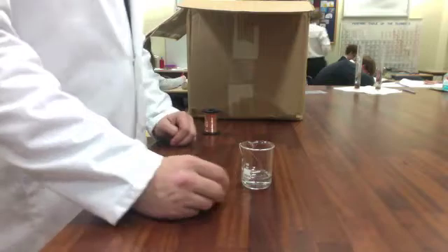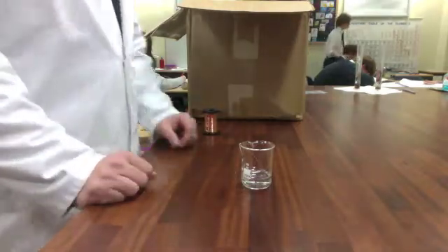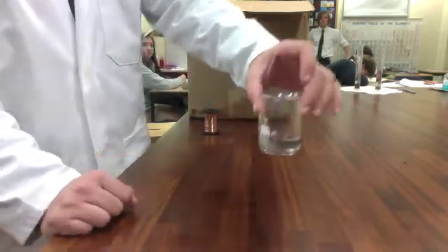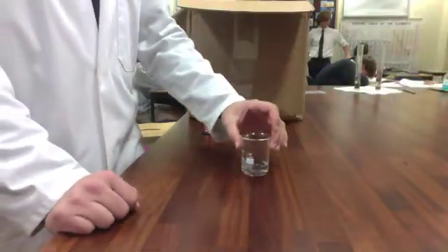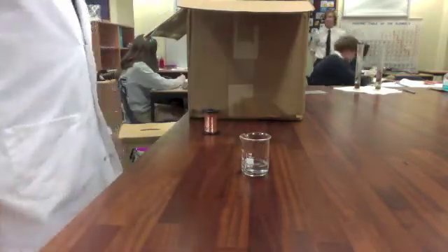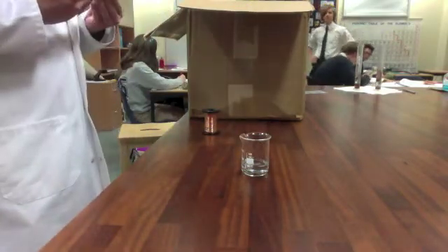Secure that. And you can see that pretty quickly a reaction starts to happen. The copper wire begins to change colour. What we're going to do is let this sit here for a little bit, let this reaction complete itself, and then come back and take some more observations.